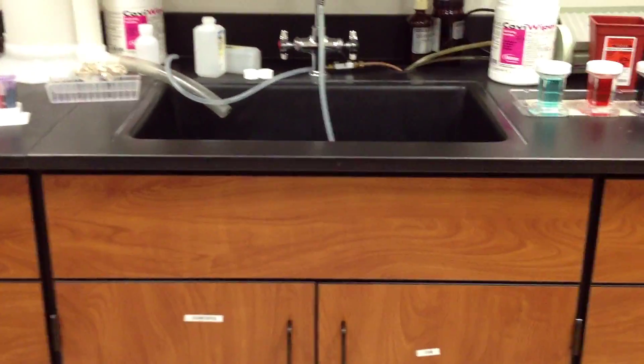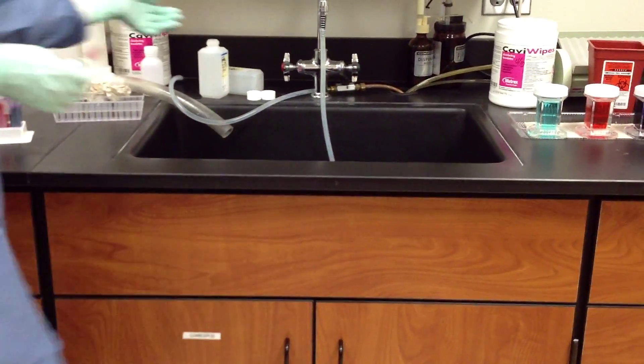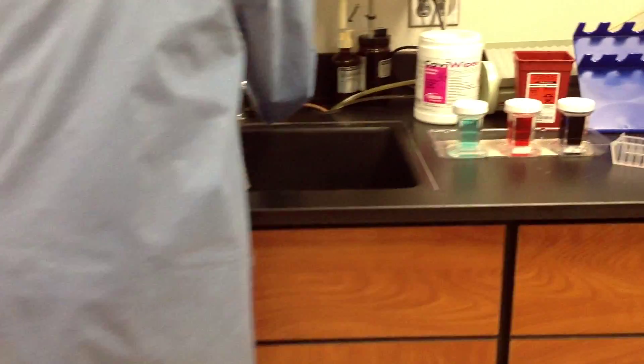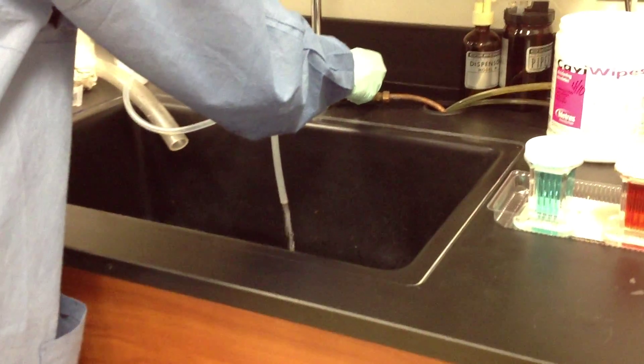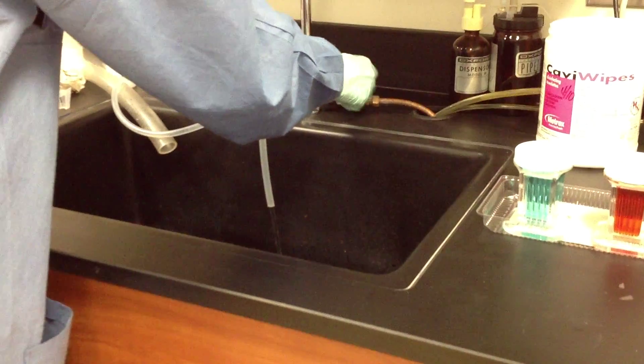First, we want to turn on our faucet with cold water and a gentle stream flowing, because we will need to rinse the excess stain off of our slides.